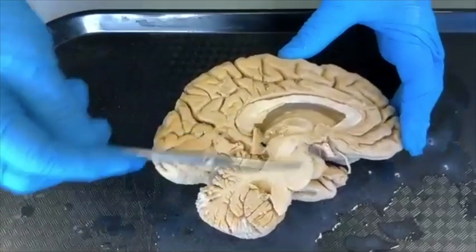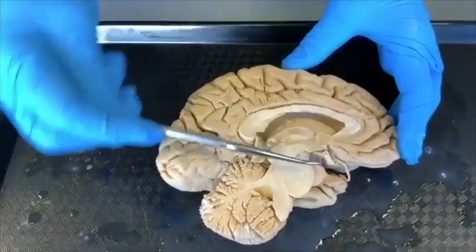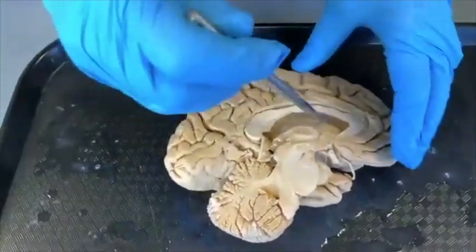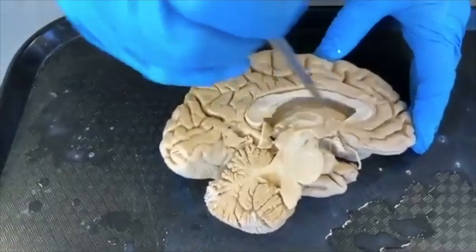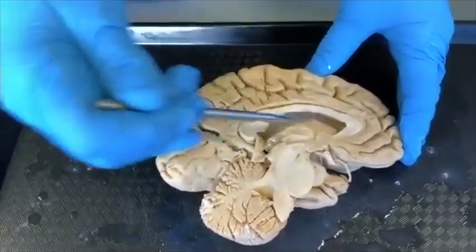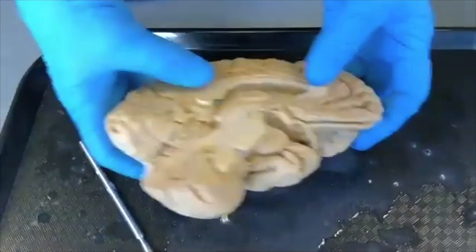So we have the hindbrain trio: cerebellum, medulla, and pons. Here's the wedge that is the midbrain. Here is the thalamus. Because I'm a little off midline, we can see into the subcortical part of the telencephalon. This is the caudate, which is part of the striatum — caudate and putamen make up the striatum.